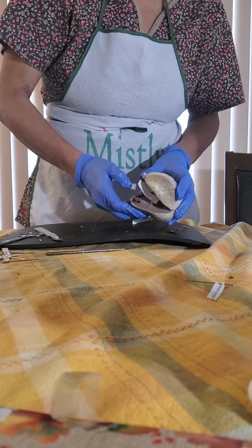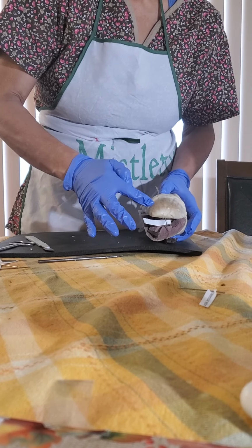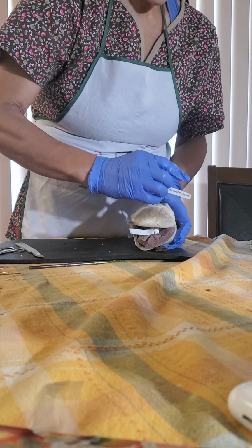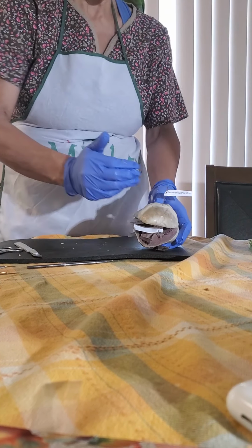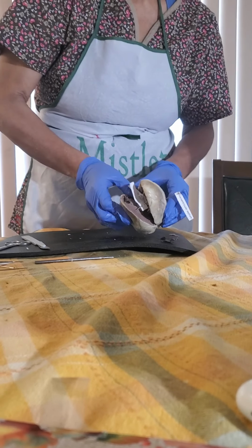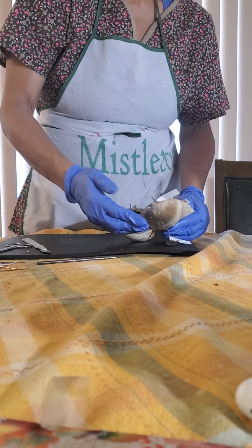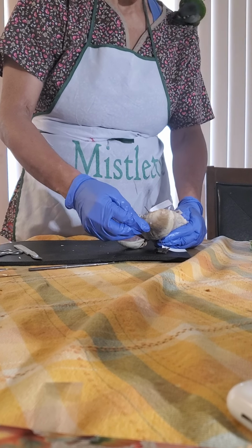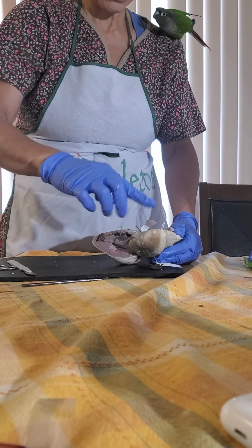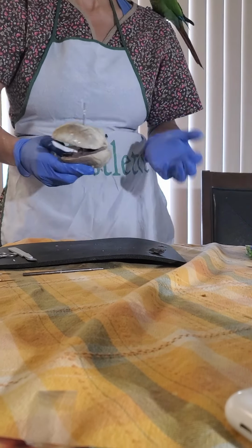And then of course this one is still the septum that divides, so the interventricular septum is what divides the heart, and it tells you what the ventricles are. Of course, remember we have the epicardium, the myocardium, which is the middle, and the endocardium, which is the innermost layer of the heart. And that's the video for me.